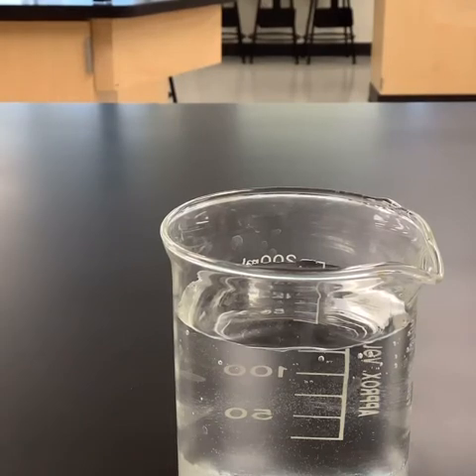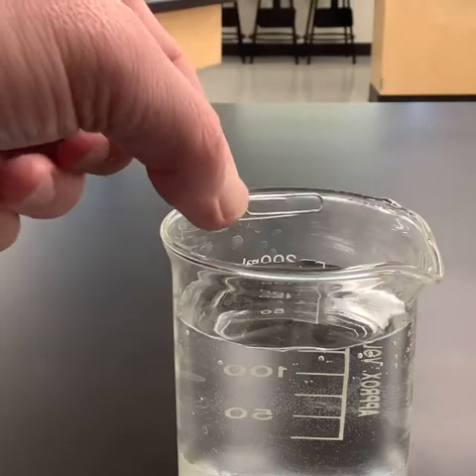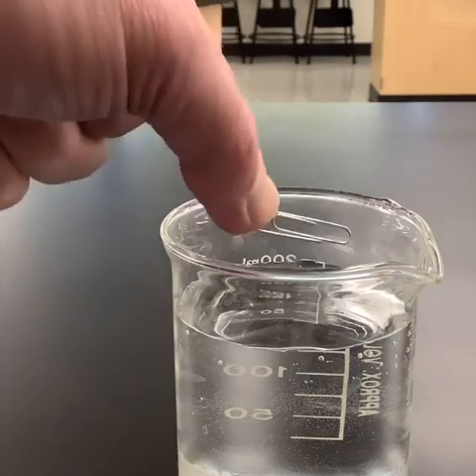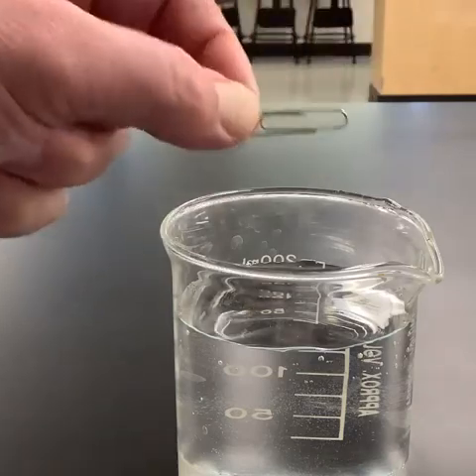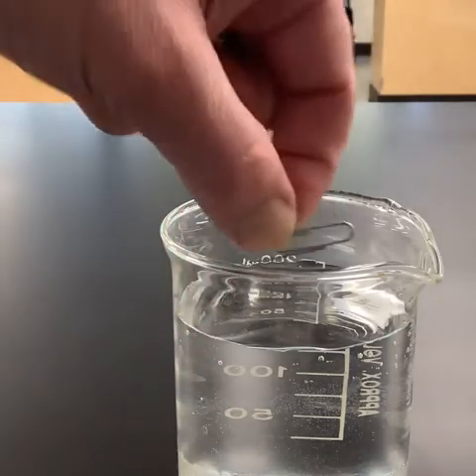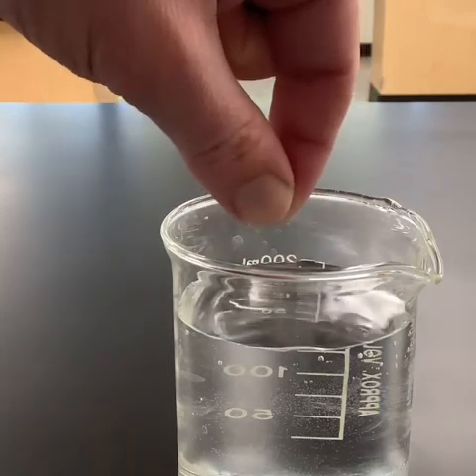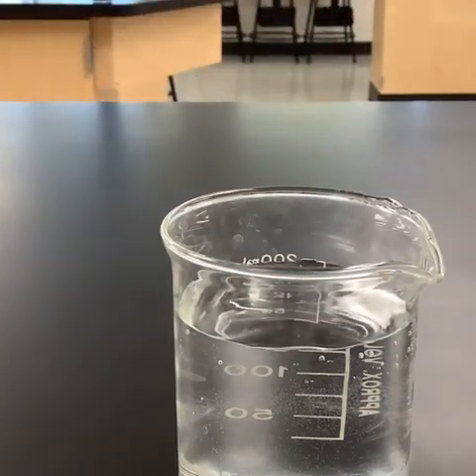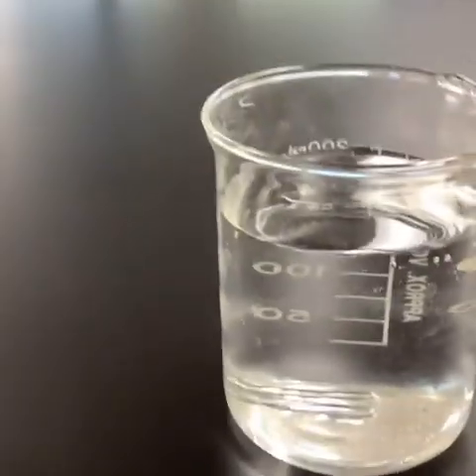So we're going to start by taking a look at water and a paper clip. If we just take a paper clip and we just put it in the water, now you'll notice I'm holding it on edge here. If we just take the paper clip and we put it in the water and we're holding it on edge, the minute that I let go, we can see the paper clip has sunk to the bottom. We see it at the bottom there.